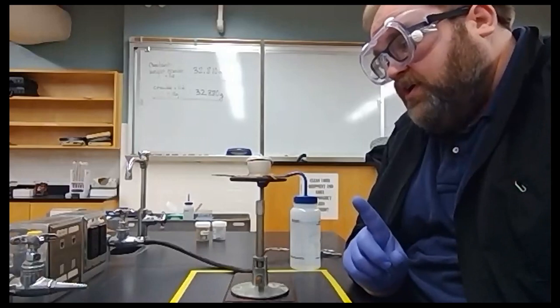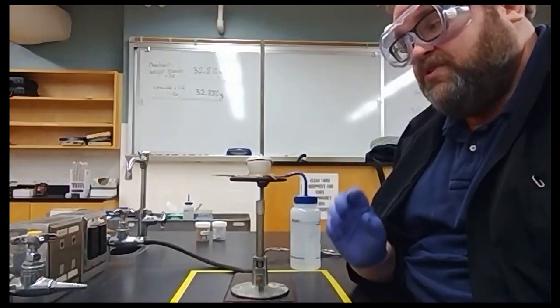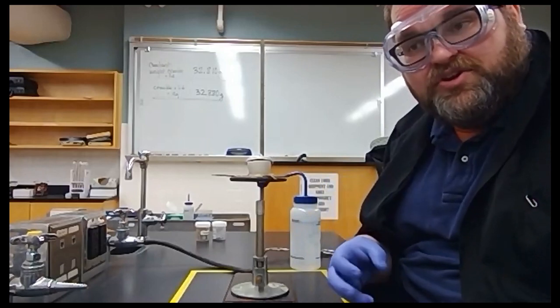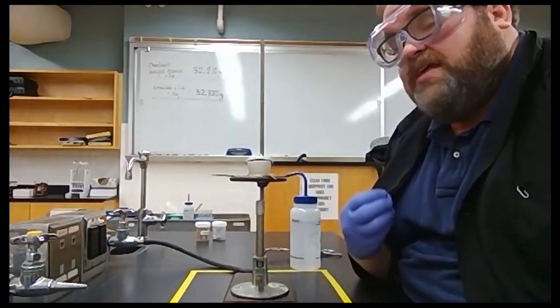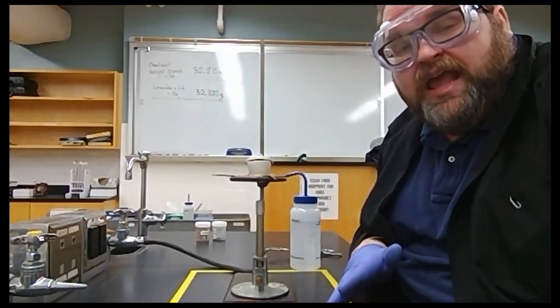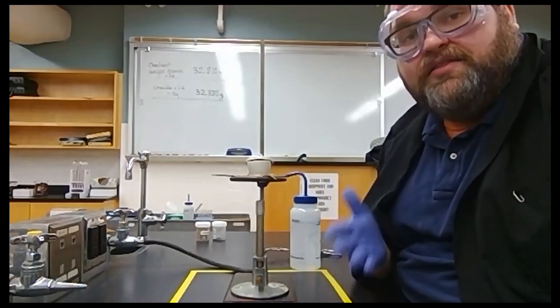And we're back. So it ignited, there was a bright white flash, and then a dull yellow light that calmed down to a red glow. We let that red glow go and go and go until the red glow went out. And when we were done, it looked like this.